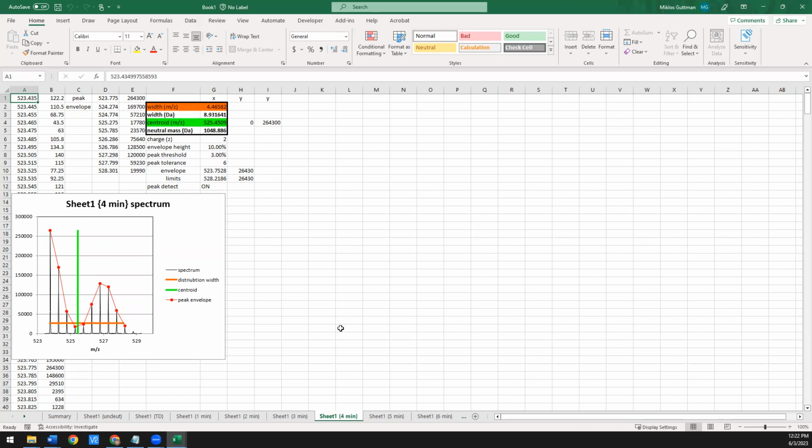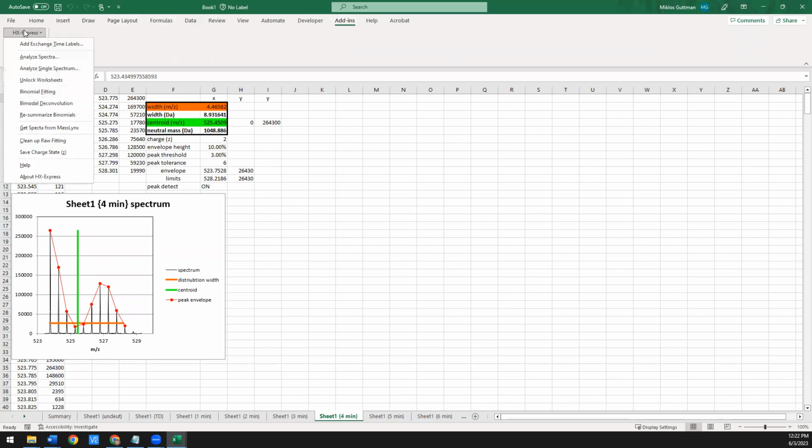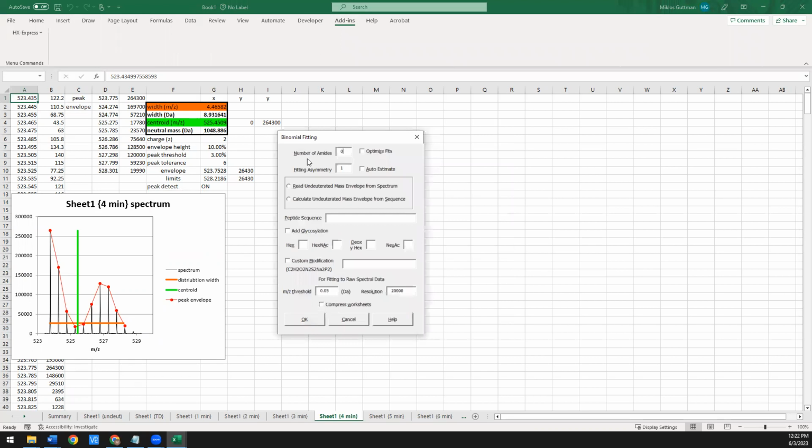So to handle something like this, what we're going to use is a binomial fitting approach. You can read all about that in the HXExpress version 2 paper from 2013. So for that, we're going to go to HXExpress, and we're going to use the binomial fitting option. When you do this, it doesn't matter where you are, which worksheet you're in. As long as you're in the right workbook when you open this, it'll apply it to that workbook. So to do this, you have to specify a few parameters.